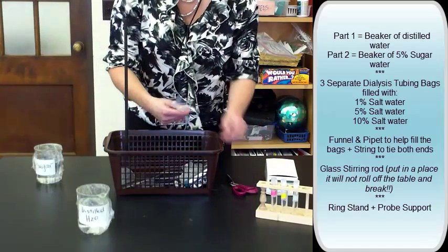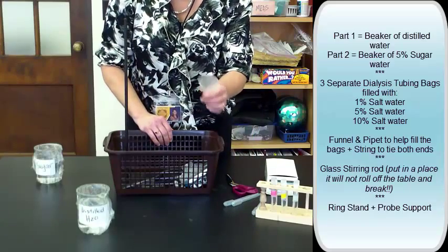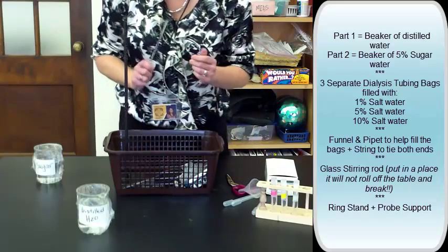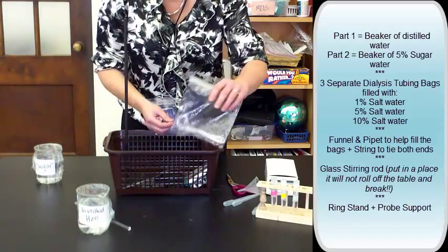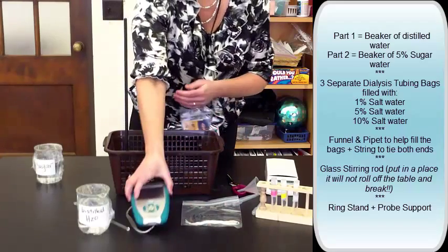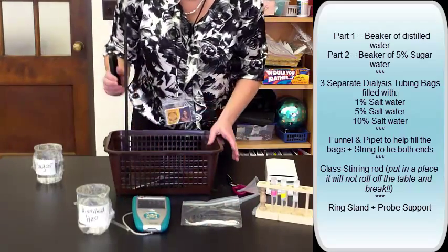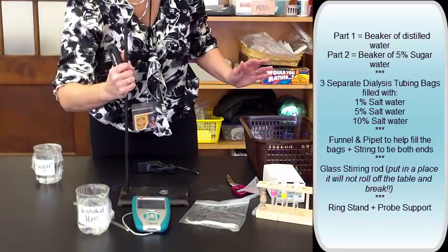Scissors if you need them, pipettes to help you fill the bags, the funnel to help you fill the bag, you're going to use a stirring rod when you stir the solution with the conductivity probe, string to tie off both ends, and you've seen this before, your LabQuest, and your ring stand and support to hold the probe.